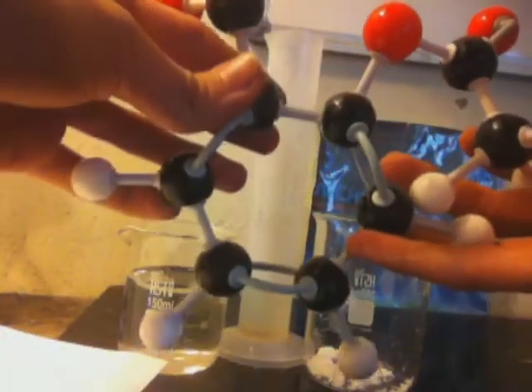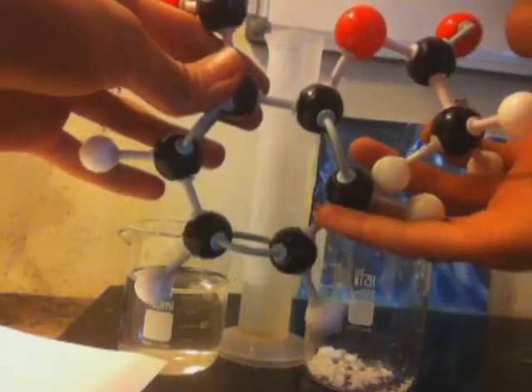The ASA is actually just crushed Aspirin. This has binders and stuff. This is the molecule of the ASA.